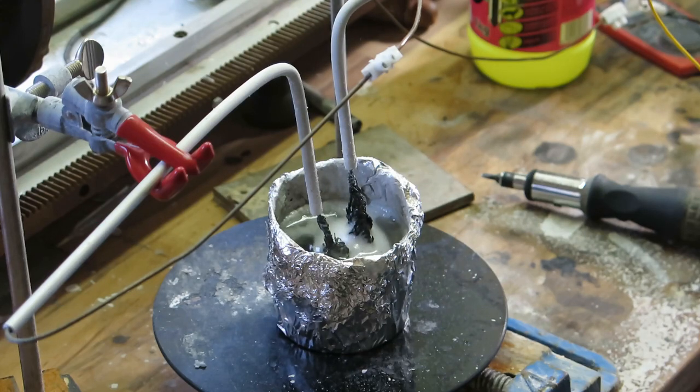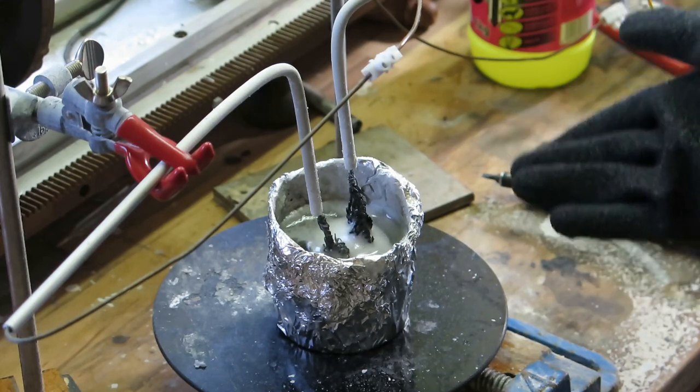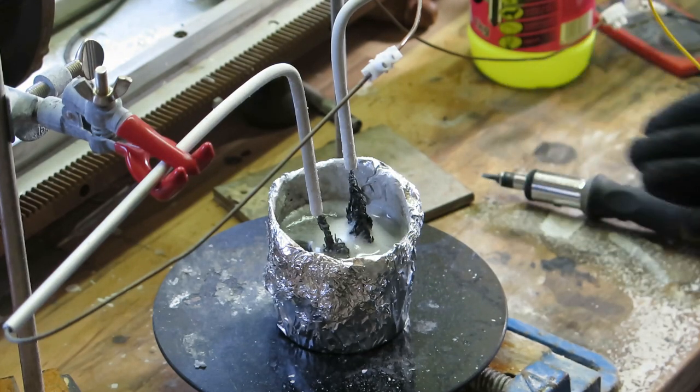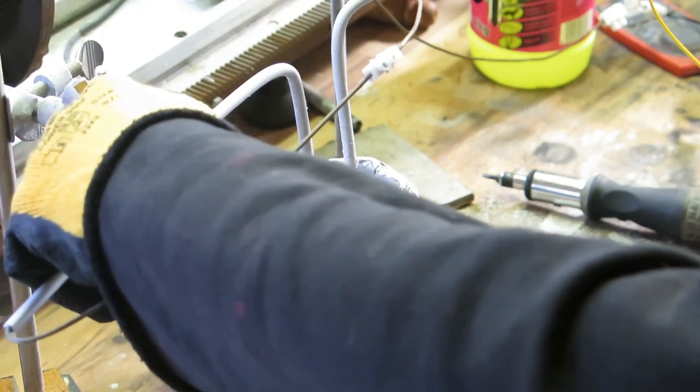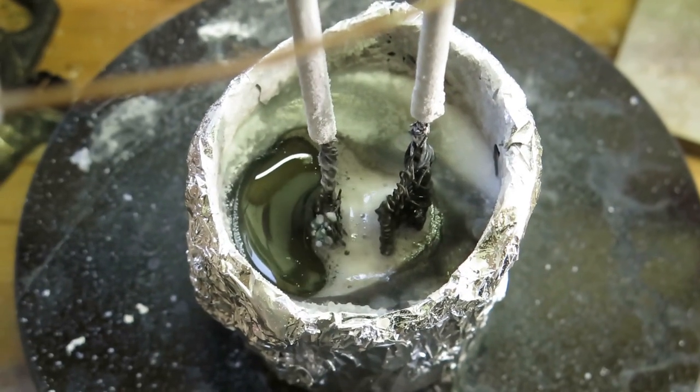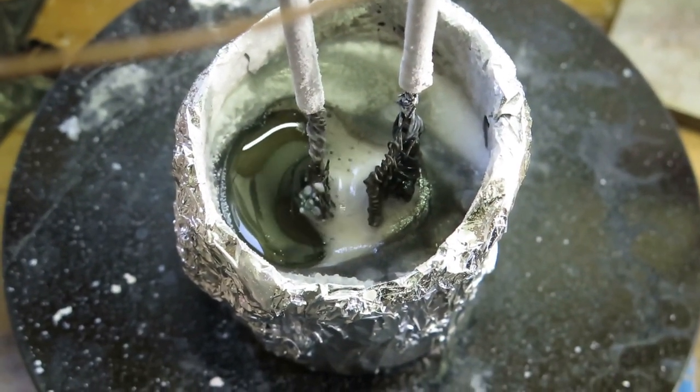Okay, got 14 amps, and well, this experiment is pretty bad because a bunch of aluminium has already been wetted, so this sucks. And the current is steadily but slowly dropping down. I don't think this will be any better, really. Let me try to move the electrodes a little bit closer. Have a look how the molten material is distributed.